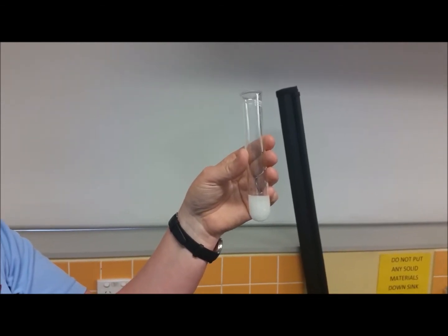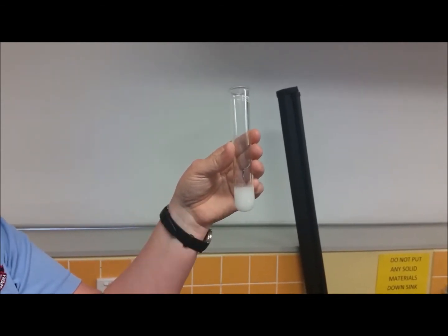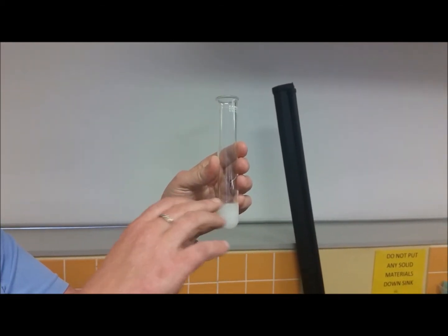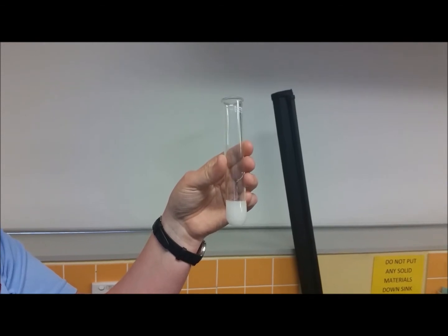Again, like when you did the test the other day, I've got starch in here. You'll be putting your food onto a tile or into the bottom of a test tube and then carrying out the test.